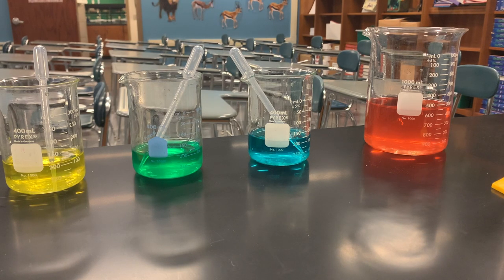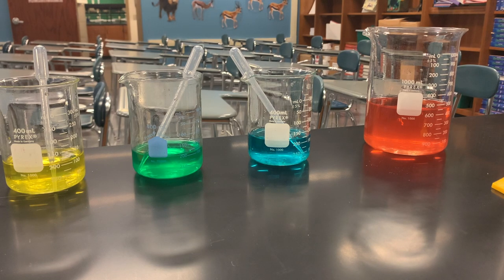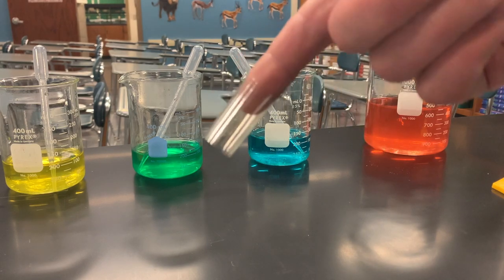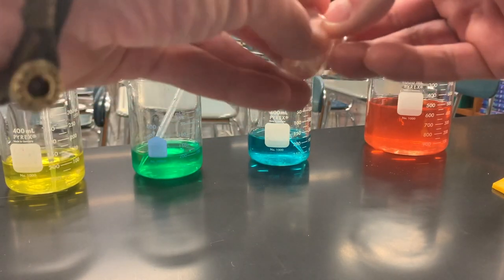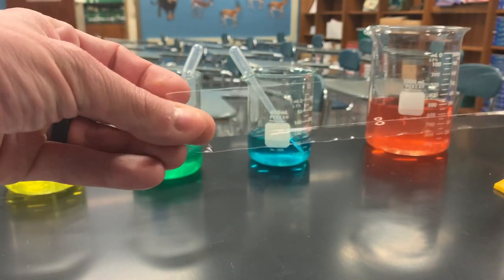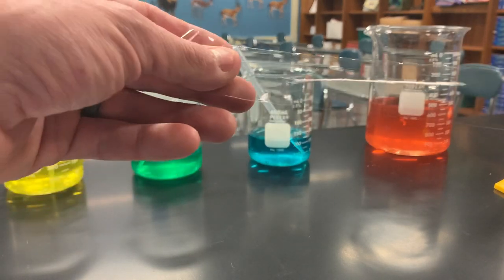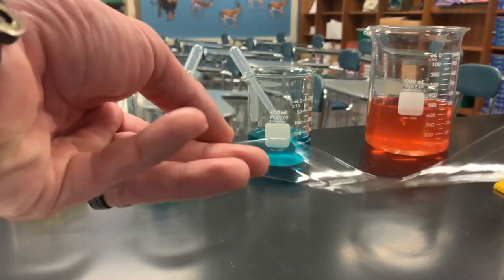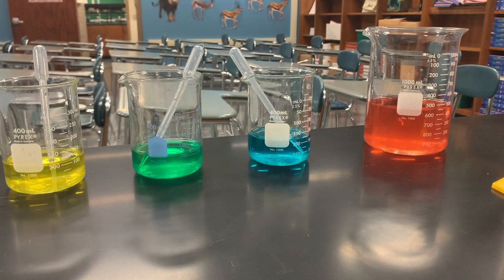What we're going to do is simulate the cell, and how I'm going to do that is I'm going to use this thing called dialysis tubing. I know it's kind of hard to see, but that's dialysis tubing. It probably looks like saran wrap right now, but it will actually turn into a tube here momentarily.